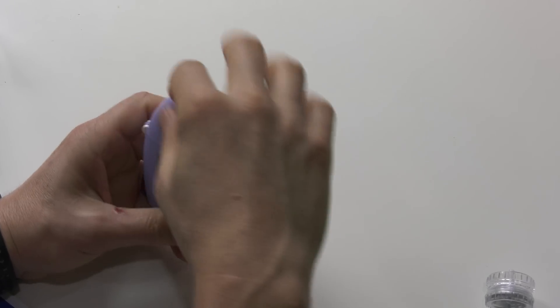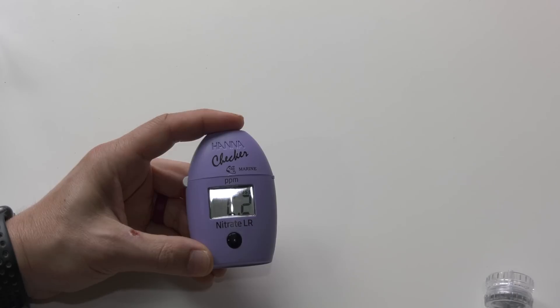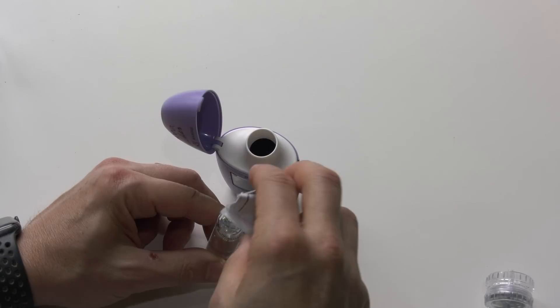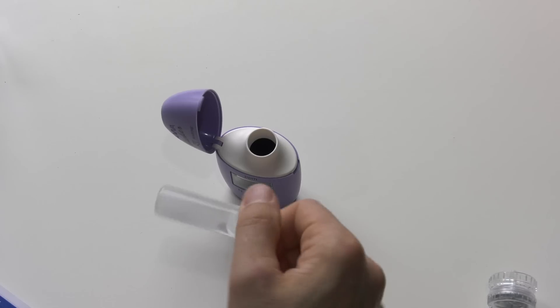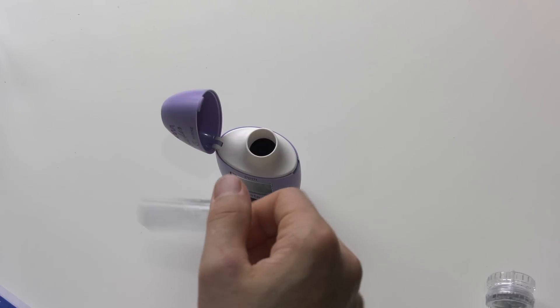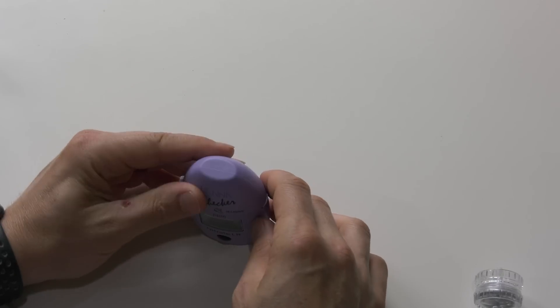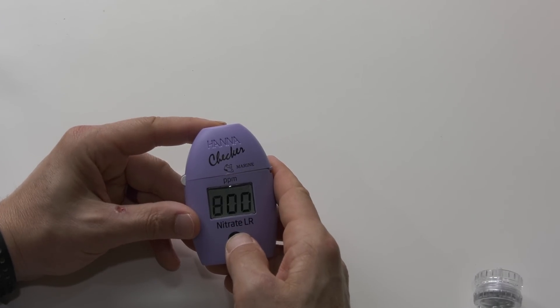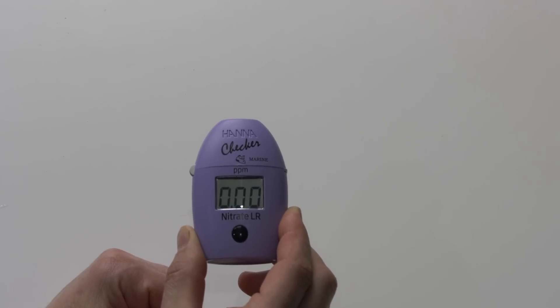Then place the cuvette into the checker and hit the on/off button. The checker will zero itself and display C2 on the screen. Now remove the cuvette and add one packet of reagent C. Replace the cuvette cap and shake hard for two minutes. Then place the cuvette back into the checker and hold down the button until the eight-minute counter starts. Eight minutes later — voila — there's the reading.